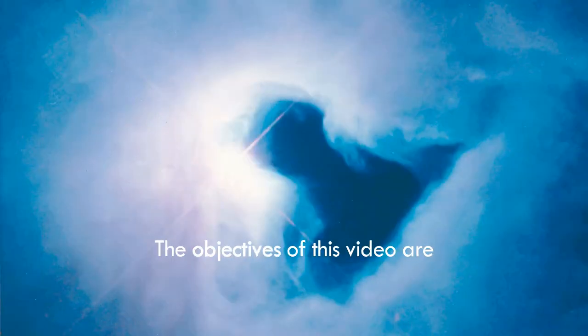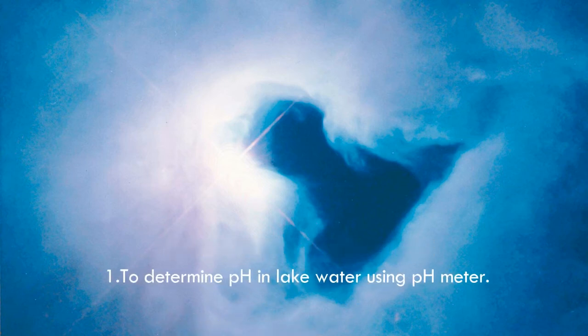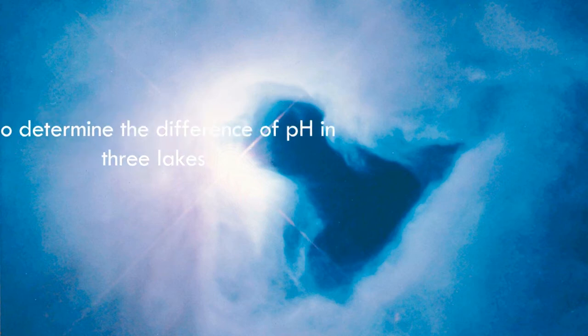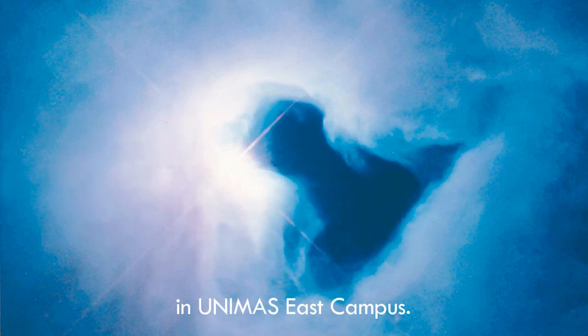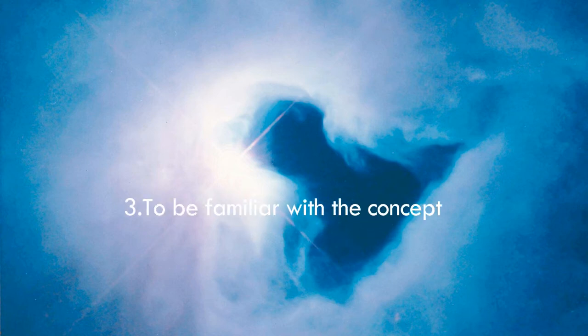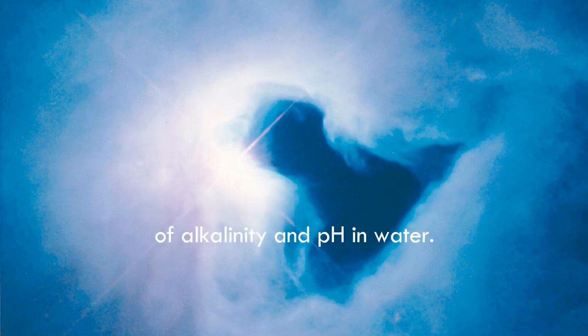The objectives of this video are: 1. To determine pH in lake water using a pH meter. 2. To determine the difference of pH in the three lakes in Unimas East Campus. 3. To be familiar with the concept of alkalinity and pH in water.